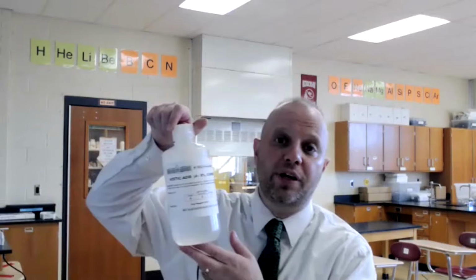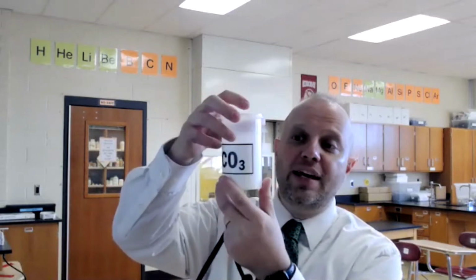Hi, everyone. In today's Stoichiometry Lab, we're going to be putting into practice some of the things that we've been learning about over the last few days. In our lab today, we're going to be combining acetic acid, which looks like this, it's just a clear solution, with sodium bicarbonate, which is like this, a white powder. And you probably better know these each as vinegar, commercial vinegar like we would get at a supermarket. And this is baking soda.